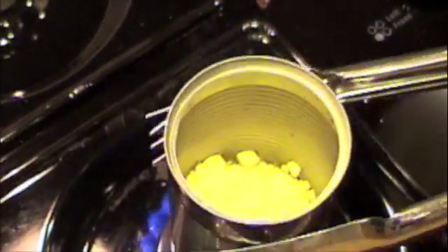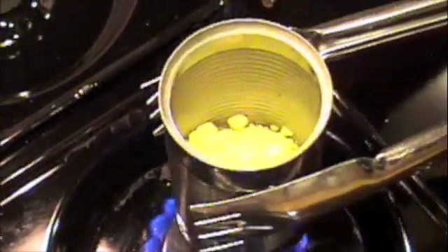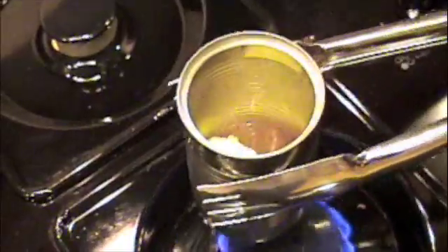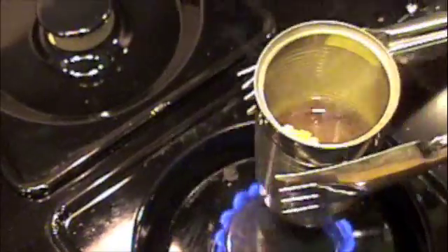The most important thing to do here is to try and prevent it from catching on fire, which is why it's very hard to do over the stove. Right now we're just melting the sulfur. If you look closely, you can see a little liquid on the outside — an orange-ish liquid forming. The smell is a mix between rotten eggs and fireworks. It started out not very viscous, kind of like water, but it's getting more thick now, kind of like honey or syrup, and about the same color — just nowhere near the same smell. Not something you would want to put on waffles.